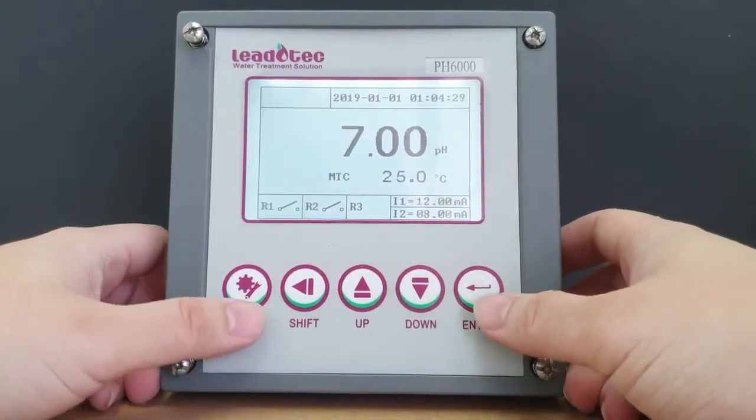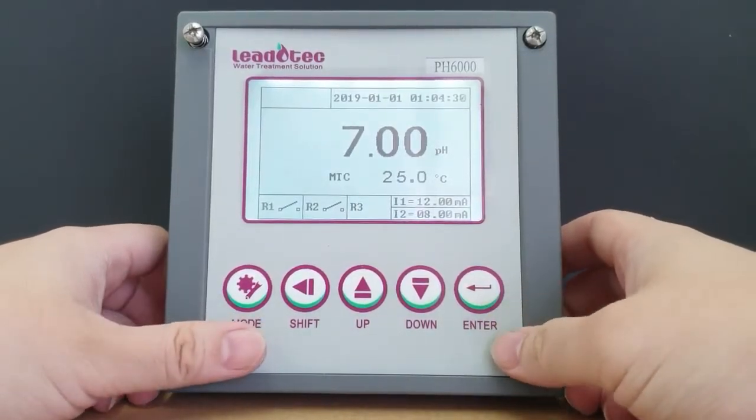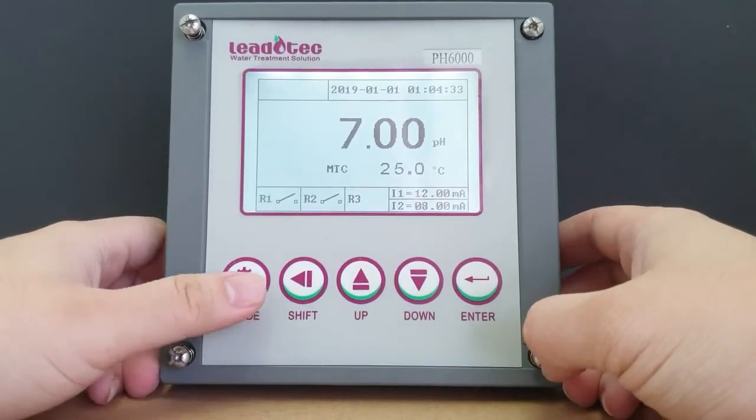Hello and welcome back to the channel. In today's video, we'll be performing calibration on a PH6000.